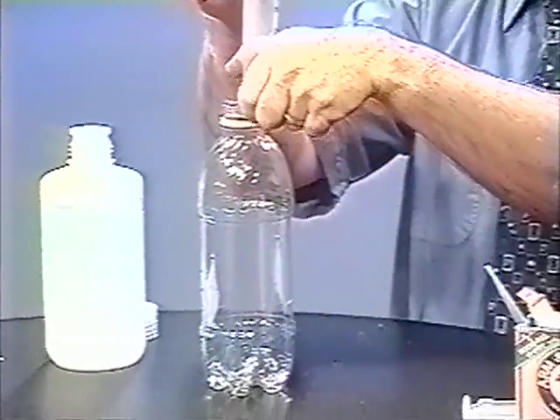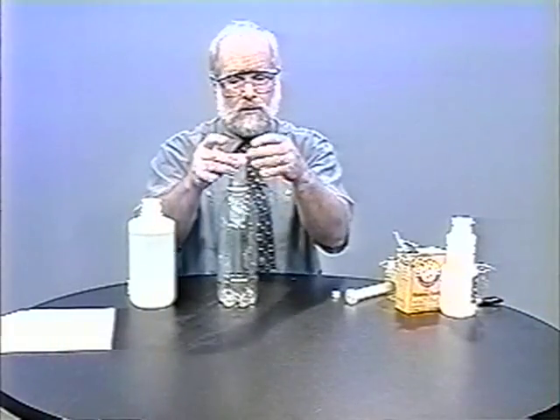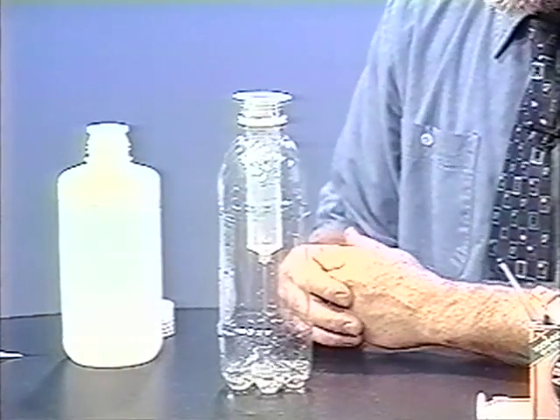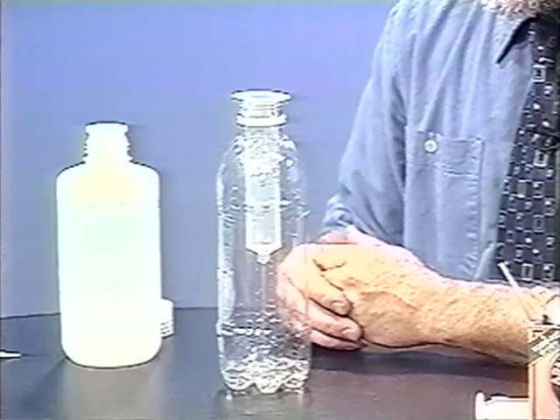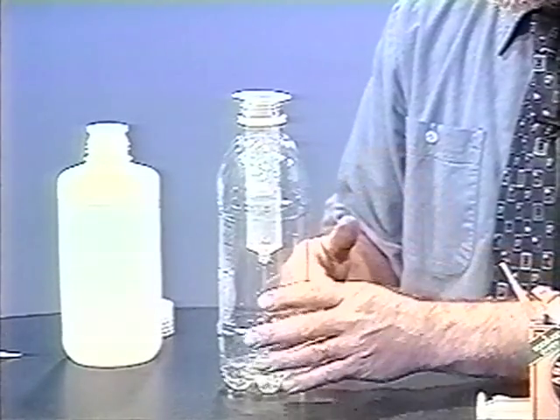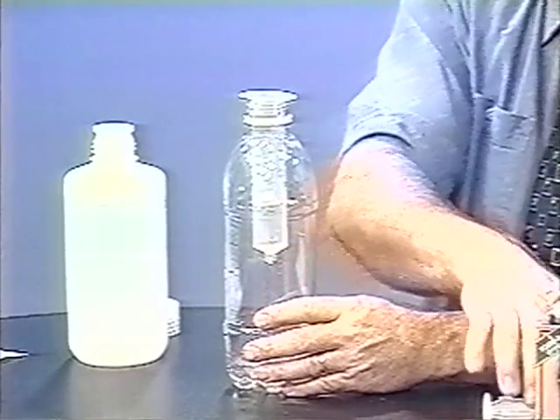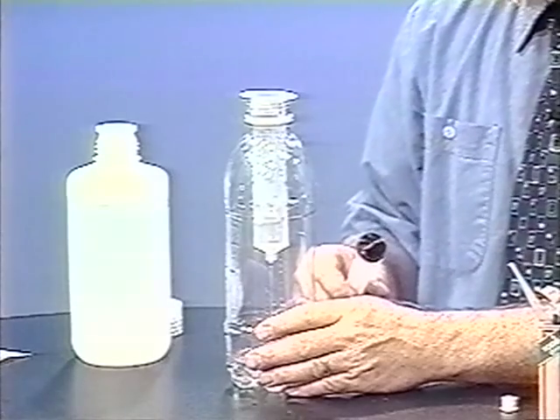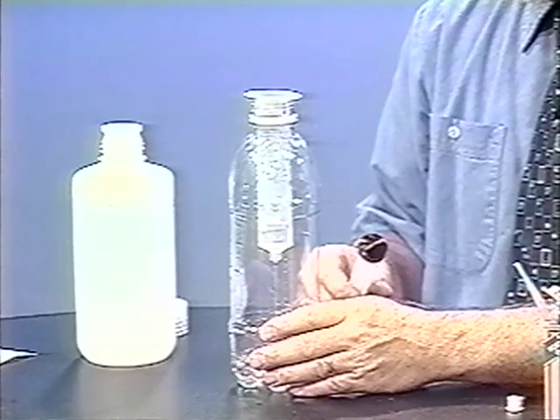We can allow the boat to be lowered simply by flotation. You can use a one-liter Florence flask or Erlenmeyer flask, but this works pretty well, and it's certainly more available and cheaper.